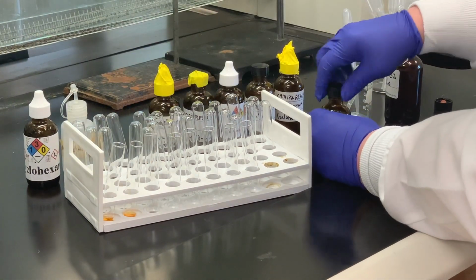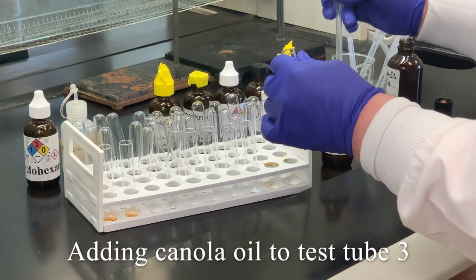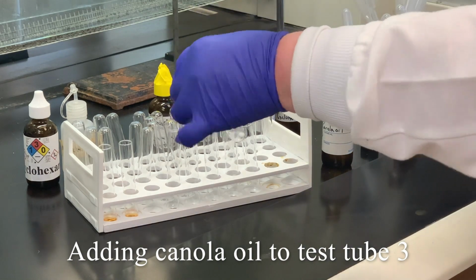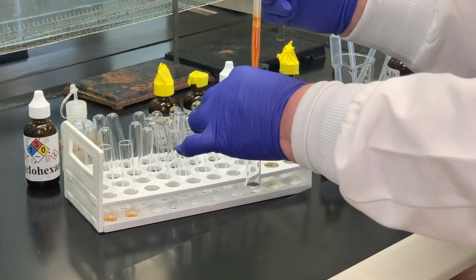To the third test tube, I'm going to add some canola oil. And then I'm going to add a couple drops of the bromine solution.